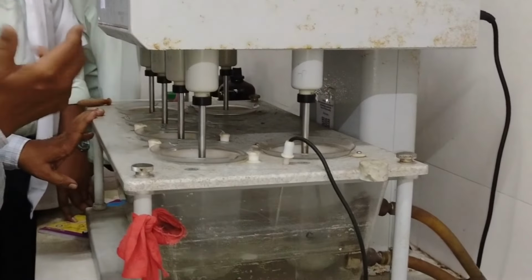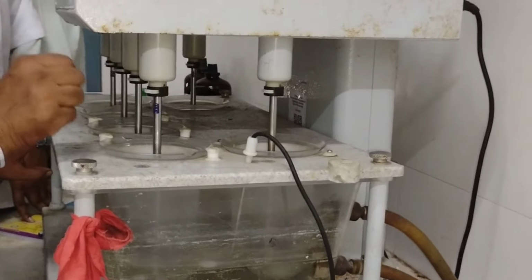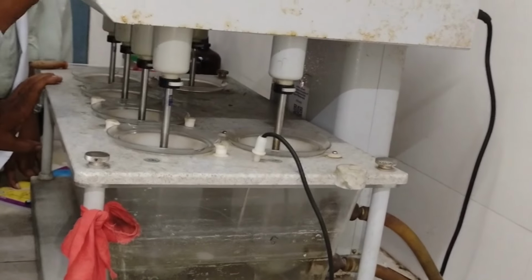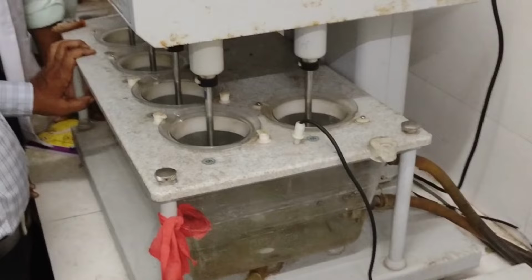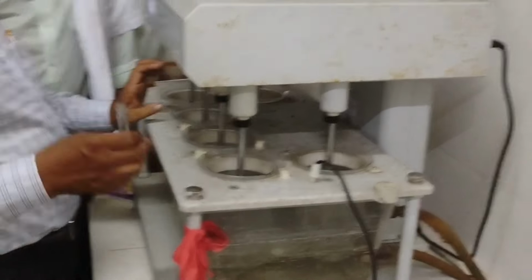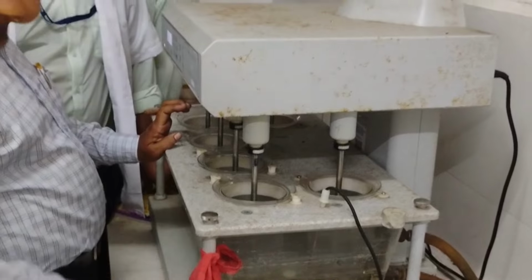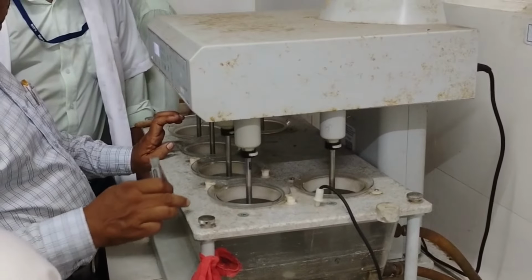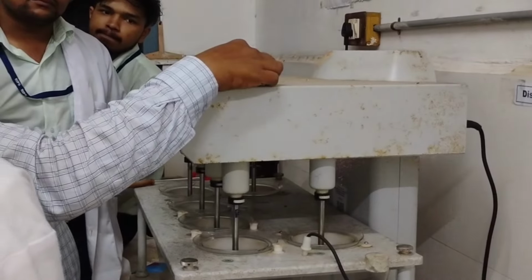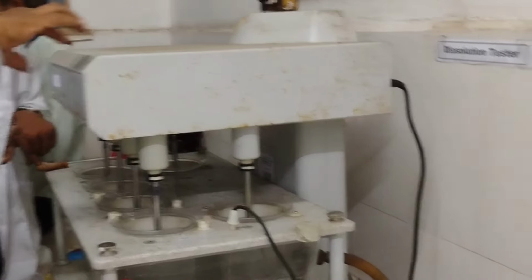The dissolution test uses an apparatus with specific test conditions in combination with acceptance criteria to evaluate the performance of the product. The rate and extent of drug release from the tablet is estimated by the dissolution test. Different types of apparatus are used to study the dissolution of the tablet as per IP: apparatus 1 paddle and apparatus 2 basket. Finally, the given tablet sample was evaluated.